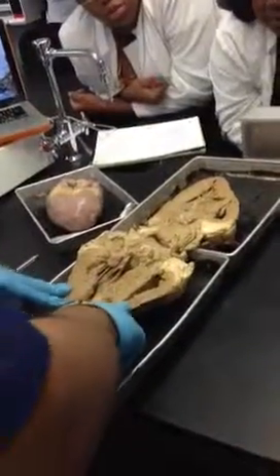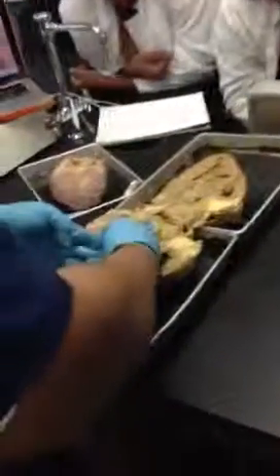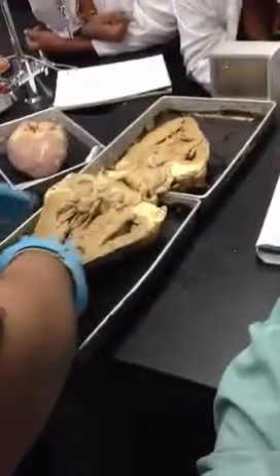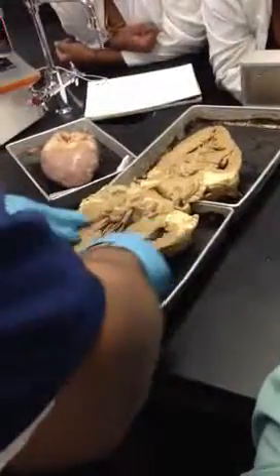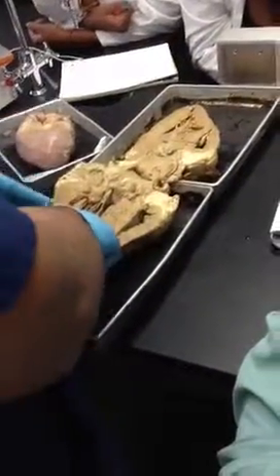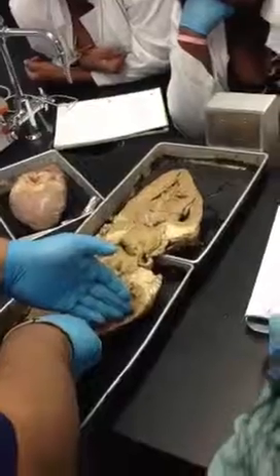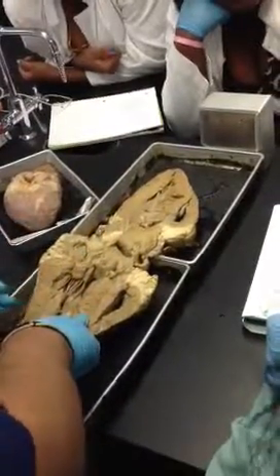Yes. Now, this structure right here that separates the two ventricles is the interventricular septum. Okay? All of this is actually myocardium. But since this is actually a specific structure, I want you to tell me that this is the interventricular septum. Okay? If I pin here or here, I want myocardium. Okay? So be very careful of it.